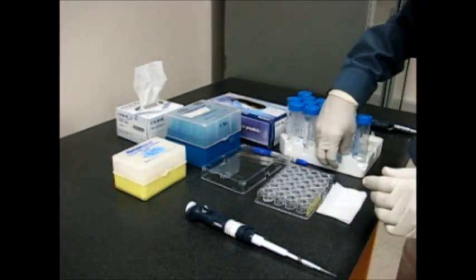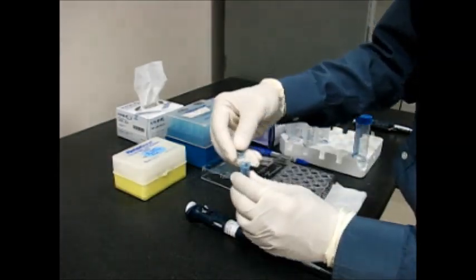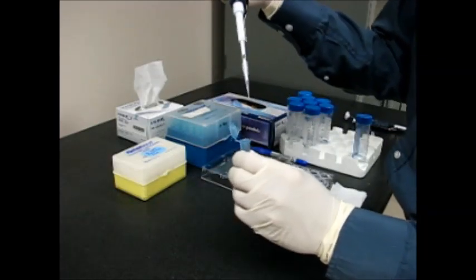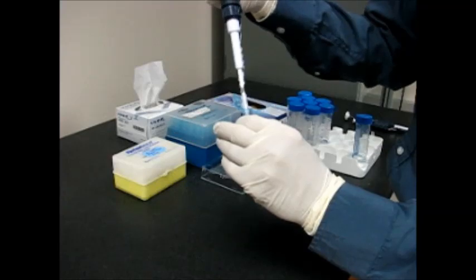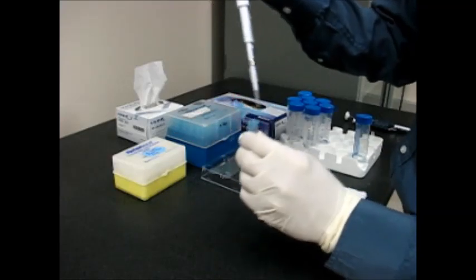Now I pick up the protein solution. I decided to do three microliter drops. Therefore I am pipetting three microliters of the protein into the pipette.